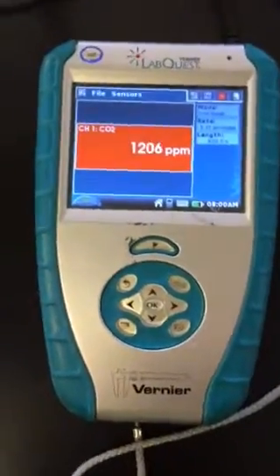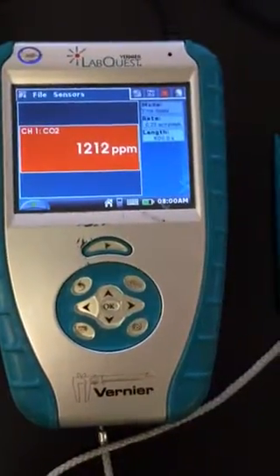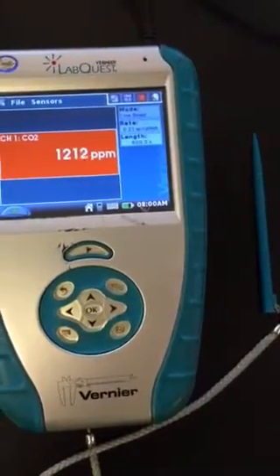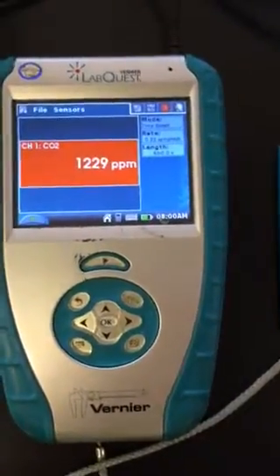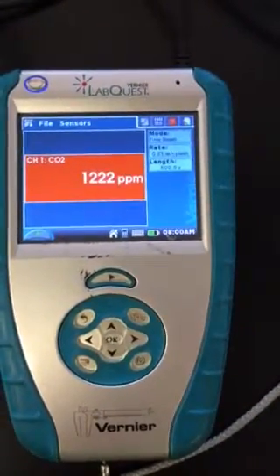A simple way that's a little less accurate is to just wait for it to normalize and say, okay, I waited and it's not really increasing much more at this point. So I'm going to say that my value of parts per million is around, let's say, 1222, because it doesn't seem like it's increasing more than that. So let's say that our value is 1222.